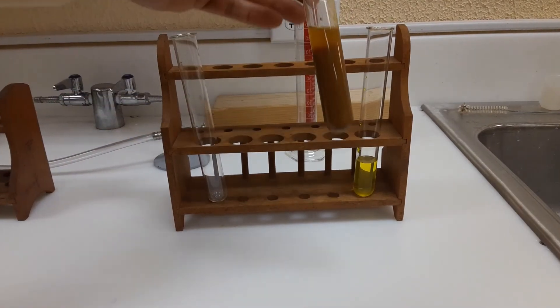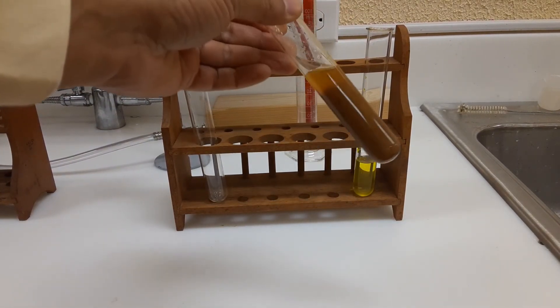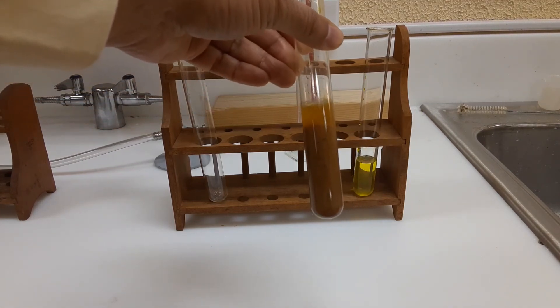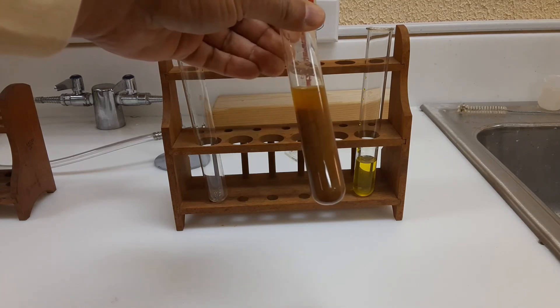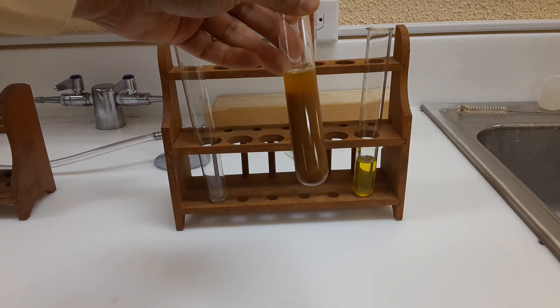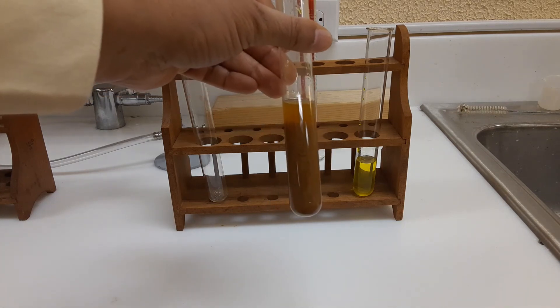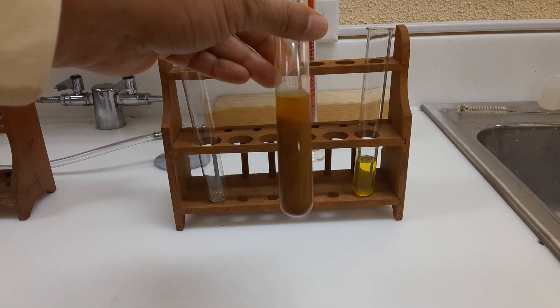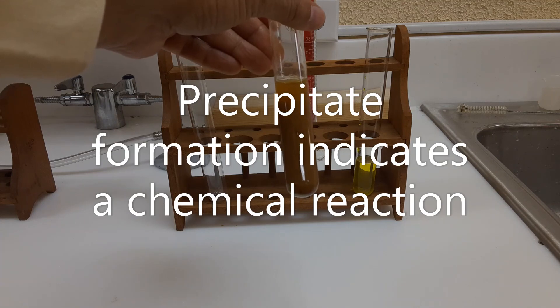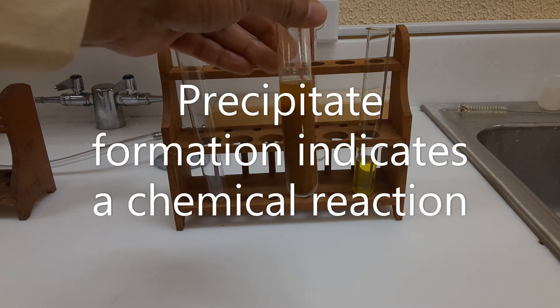We let this test tube sit for about 15 minutes. After 15 minutes, you can see that there's a clear solution at the top, but at the bottom there's a layer of solid particles — like a powder. This is what we call a precipitate. The reaction between potassium chromate and iron sulfate produces a precipitate, and getting a precipitate is another indication of a chemical reaction.